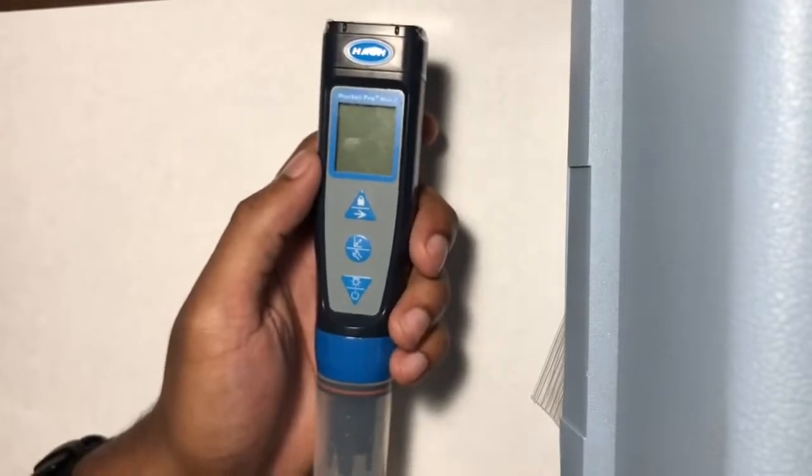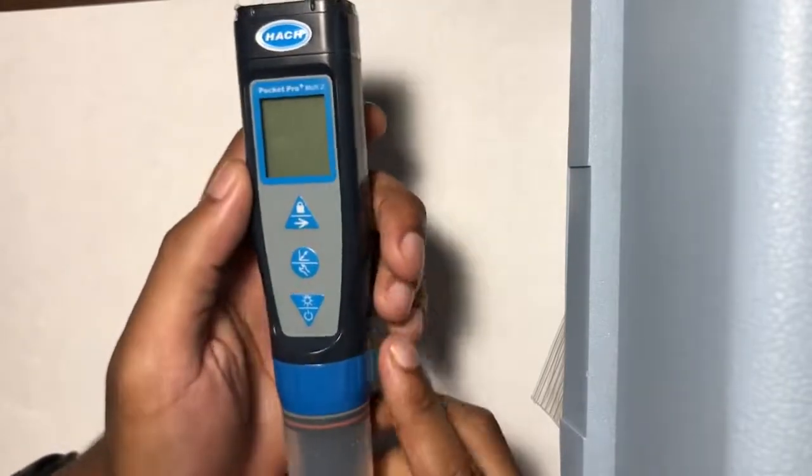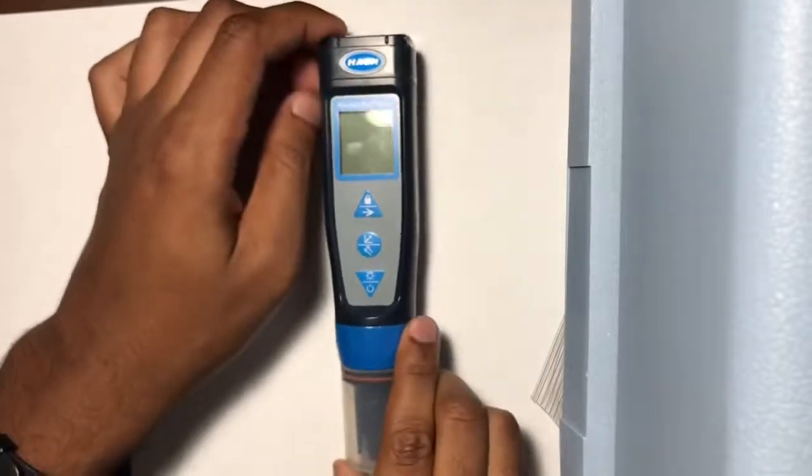Always remember to record on your datasheet if you have any issues with your meter, and any changes you made to the settings under equipment notes, and the number of your meter, so we can keep track of the information.